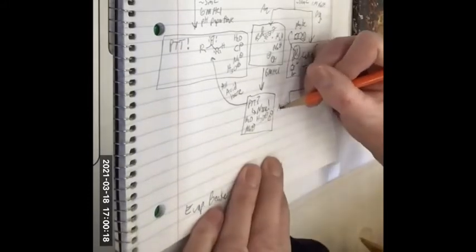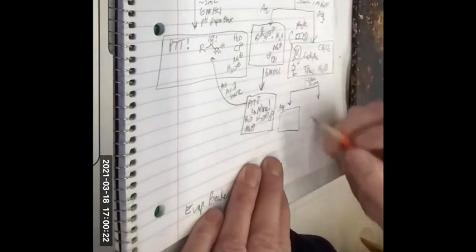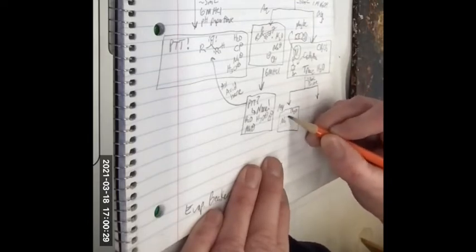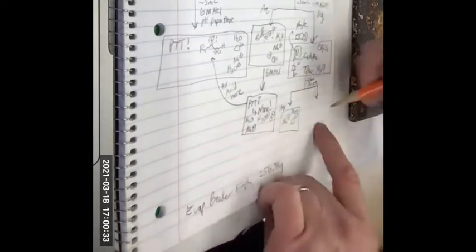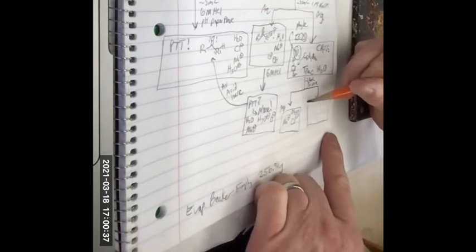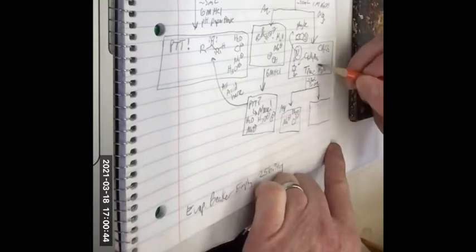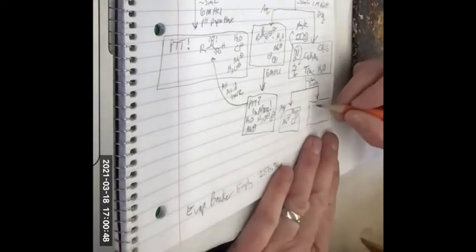And then in my aqueous layer, what did I get? You get mostly water. What else? Sodium and chloride. Is this solution, do you think, is it saturated? I'm unsure. It was saturated when it was brine, but now it's drawn some trace water out of the organic. So I'd say maybe it's not saturated anymore. It's been diluted a little bit.